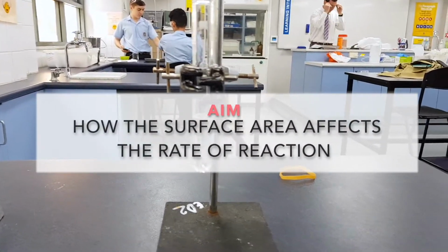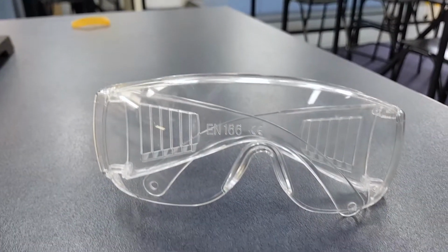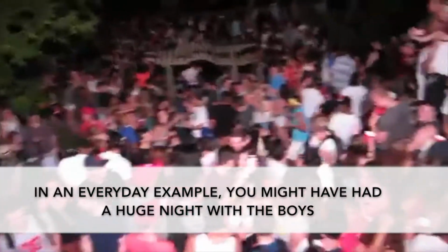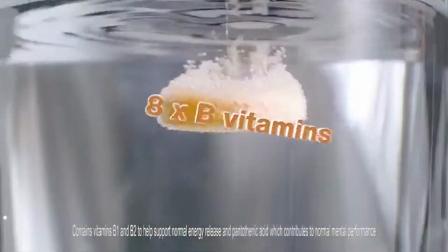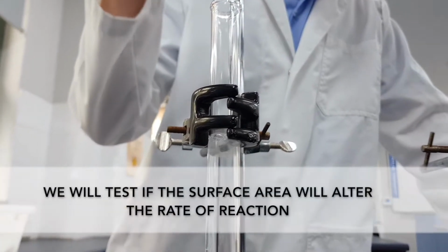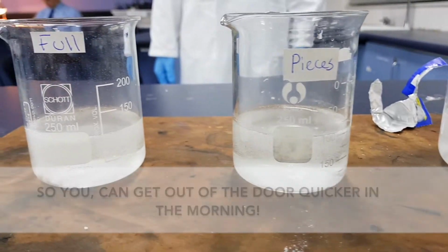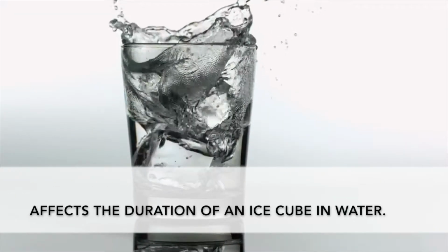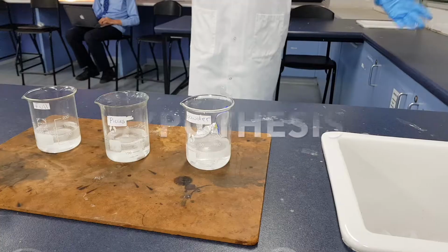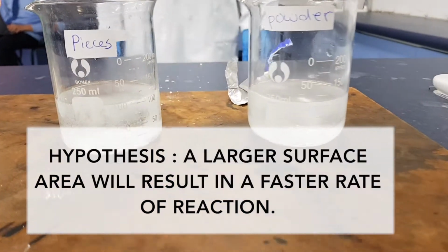The aim of our experiment is to effectively determine how the surface area affects the rate of reaction. In an everyday example, you might have had a huge night with the boys, so you take a Berocca for the big day. We will test if the surface area alters the rate of reaction so you can get out the door quicker of a morning. This can also be applied to ice cubes to determine whether the surface area affects the duration of an ice cube in water. We hypothesized that a larger surface area will result in a faster rate of reaction.